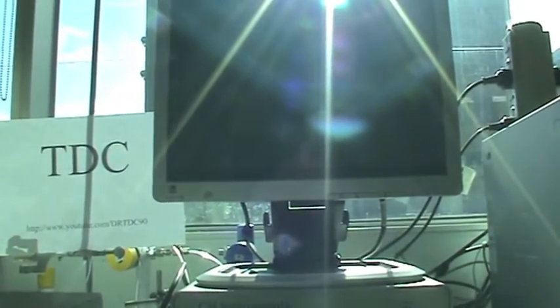To carry out the electrodeposition of lead dioxide, we need to use an electrochemical potentiostat, which is controlled by the computer.